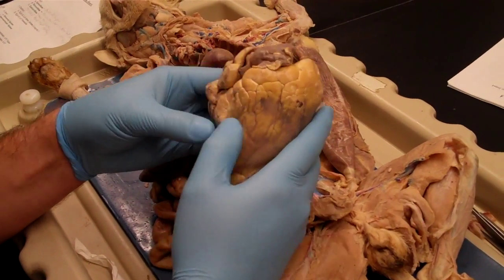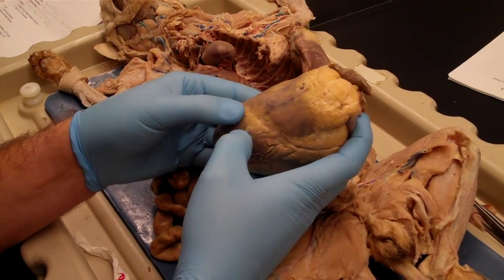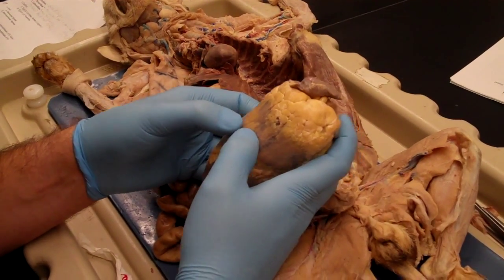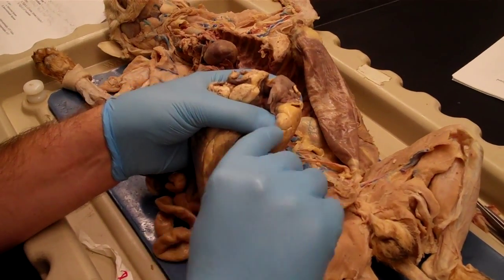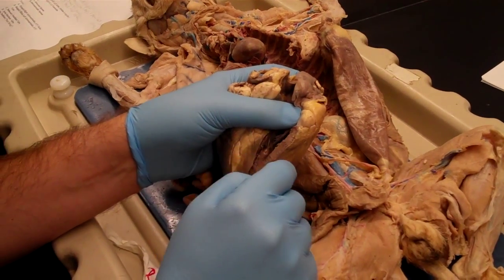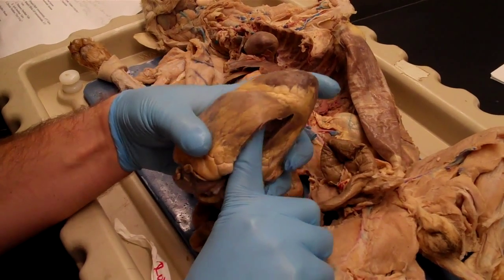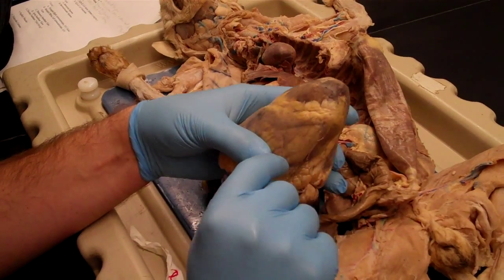If you're feeling the heart, sometimes you can get a sense of a change in consistency. If you push on this side of the line, which is left ventricle, it's relatively firm. If you push on the other side, it deforms a lot more easily, and that just reflects the wall thickness. So if we open up this right ventricle, you can see the thickness is less than half an inch. So that's going to be right ventricle. The other thing too is if you stick your finger in, you can see how my finger is stopping right at that line. So you can sort of prove to yourself that that really is where the left and right ventricles are separated from one another.